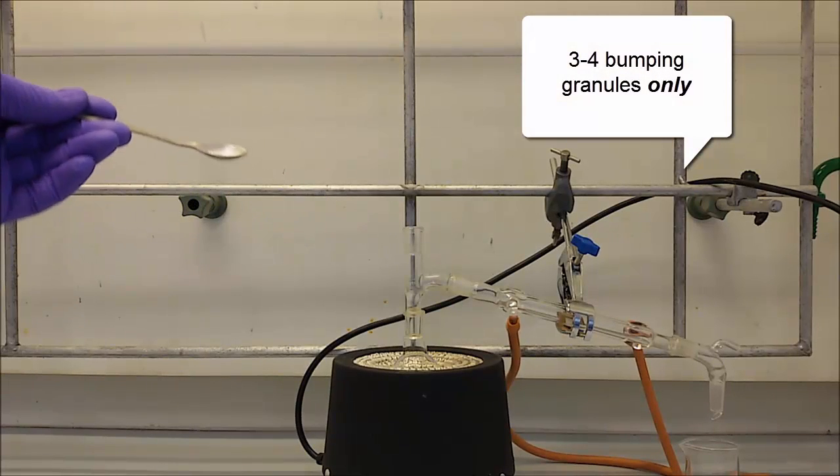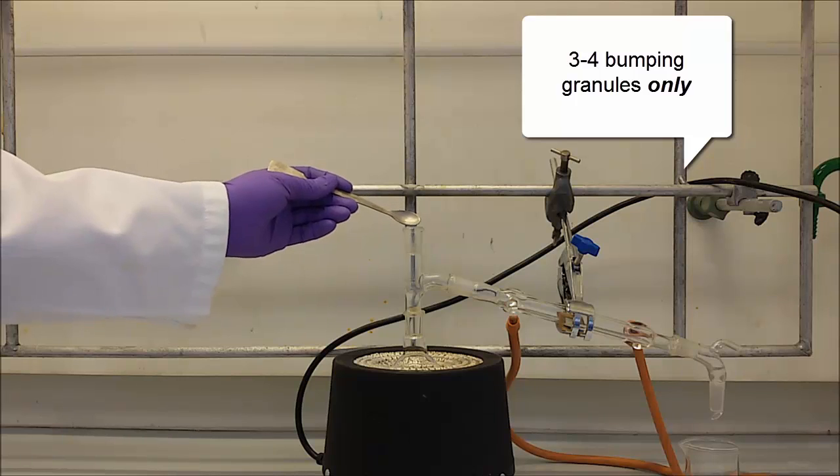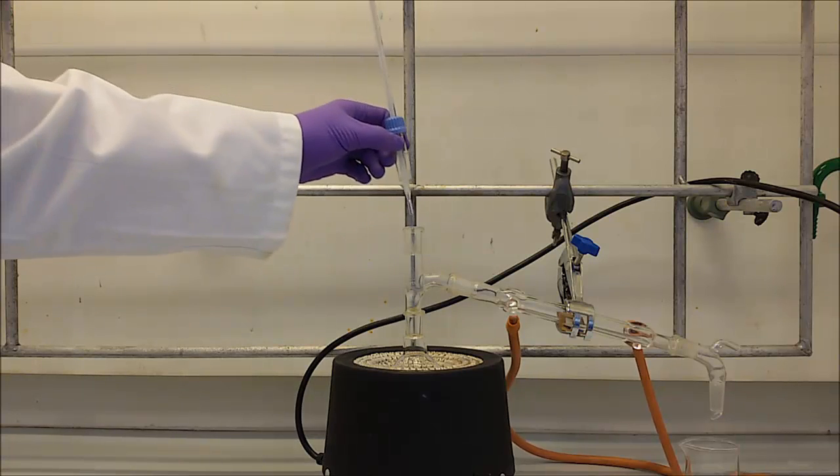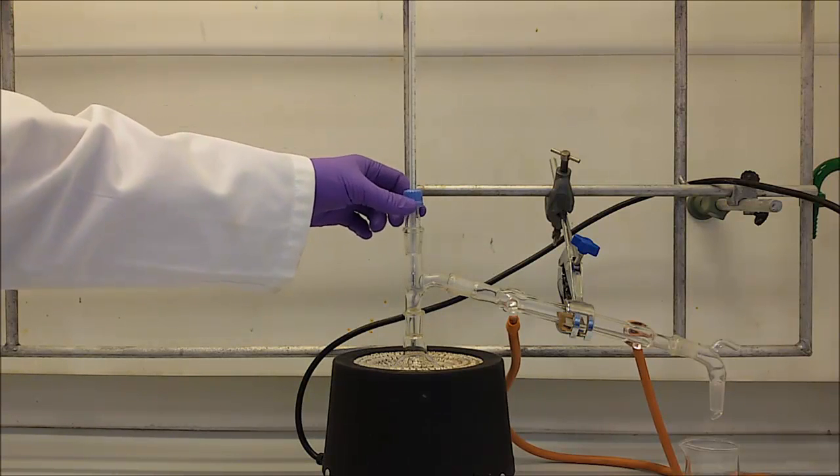It is a common mistake to place too many of them, which is unnecessary. Place the still head back.